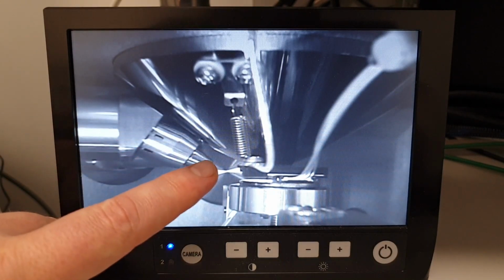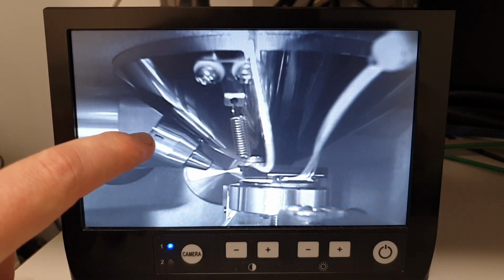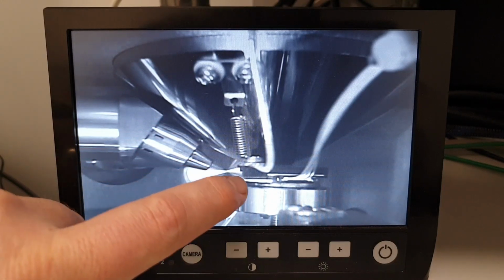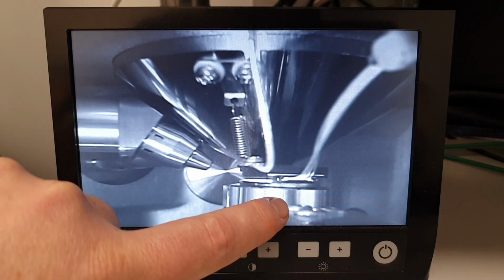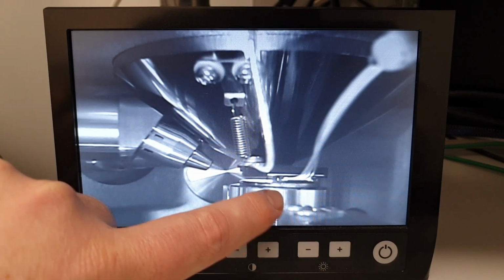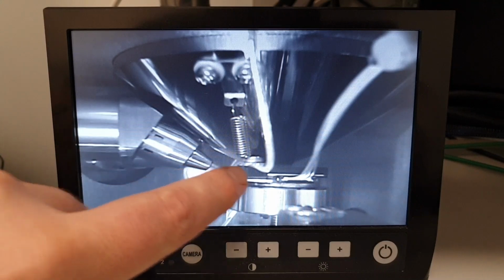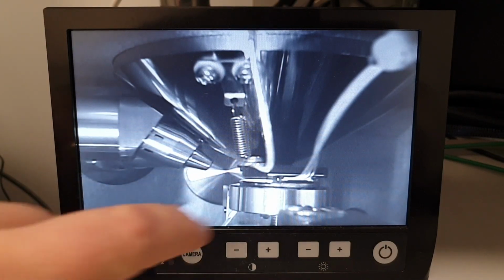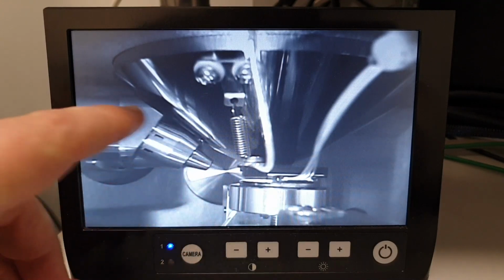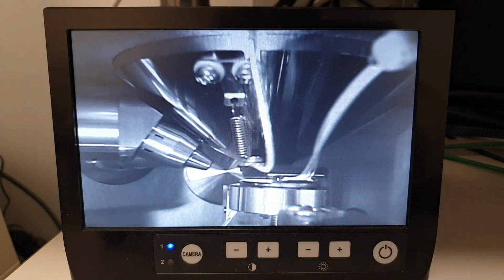This is our X-ray detector. If you follow the center line of the X-ray detector towards where the sample is, you will notice that it is actually looking below where the sample is. This doesn't give it an optimal line of sight to where the X-rays are being excited in the sample, and therefore the count rate will be lower as it is not the optimal working distance for the EDX.